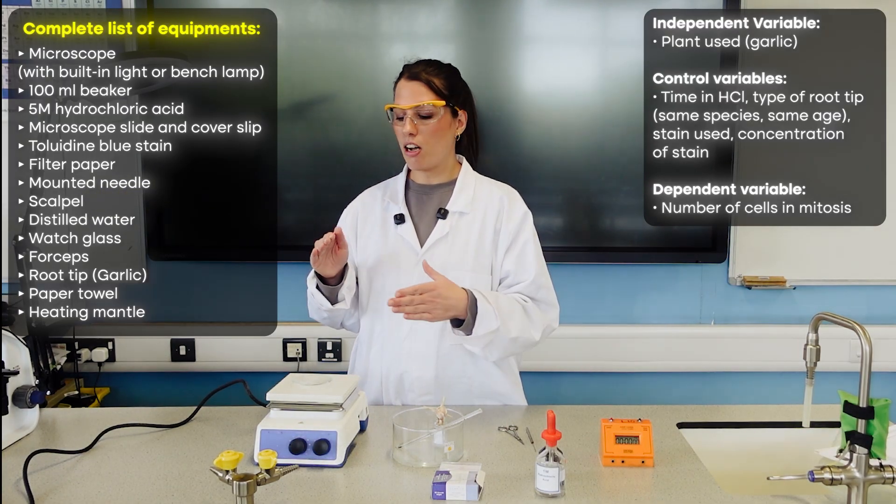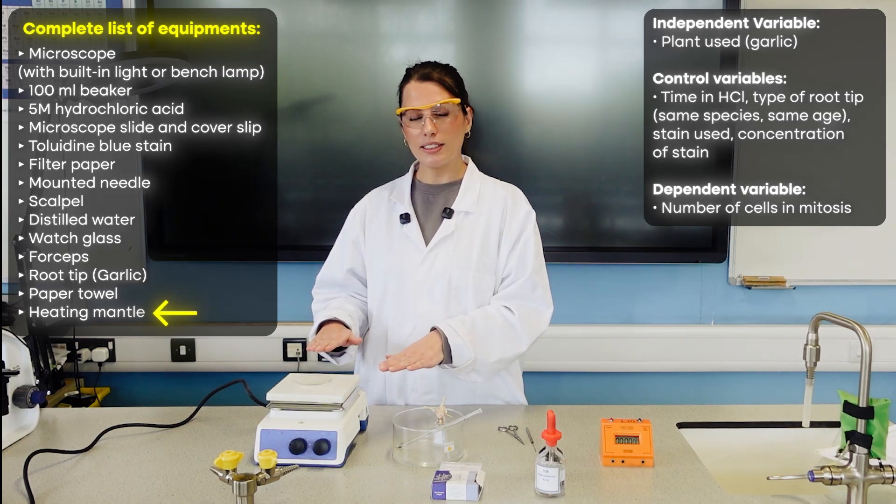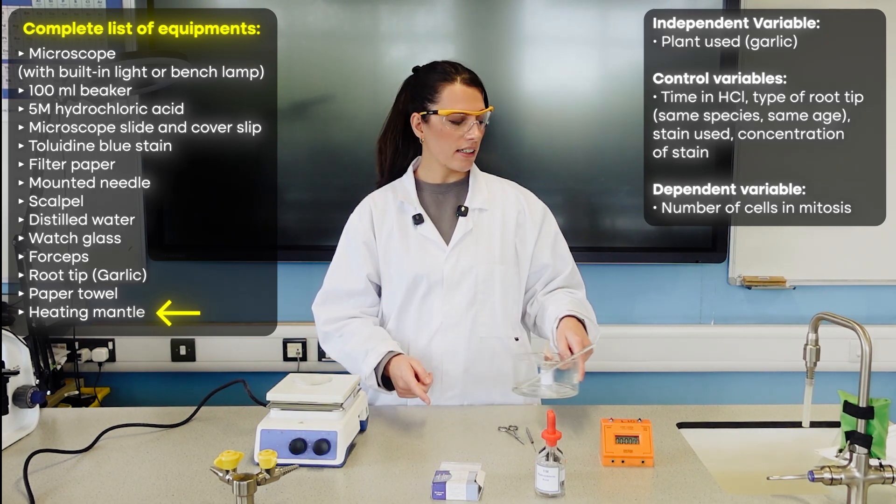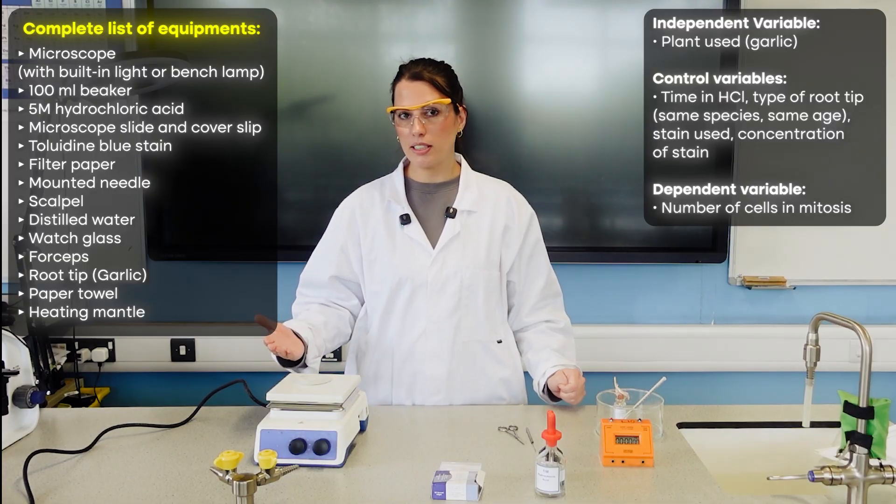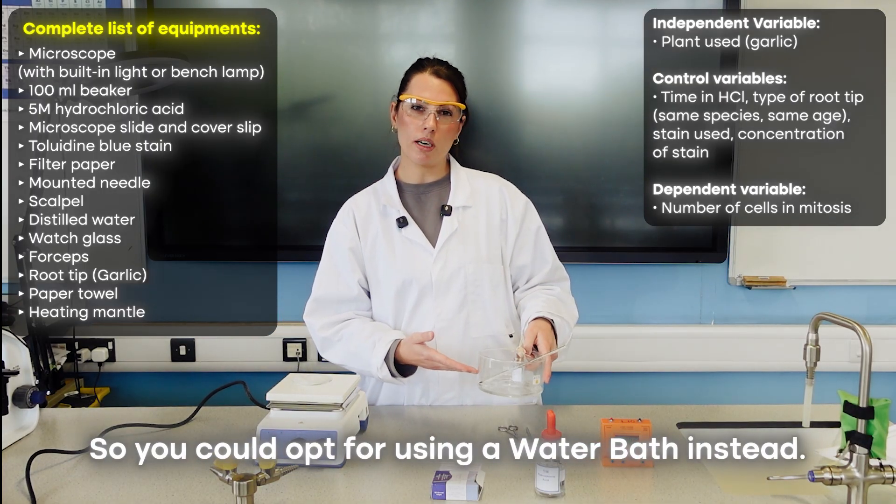For the heating stages, I'm actually going to use this heating mantle, this heating plate because it's far safer in terms of not having hot water that could scald and spill and not using a naked flame, but you may not have this. You could opt for using a water bath instead.